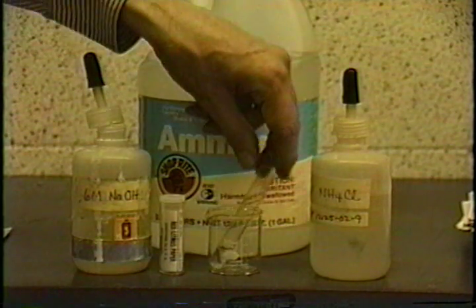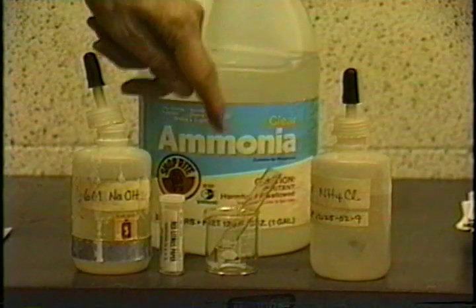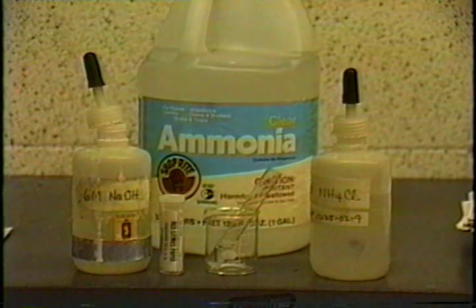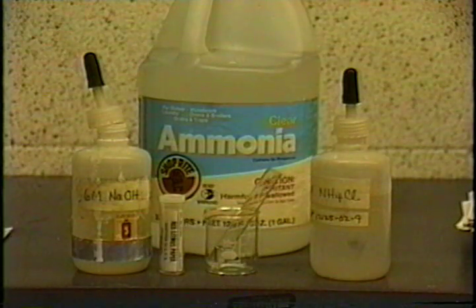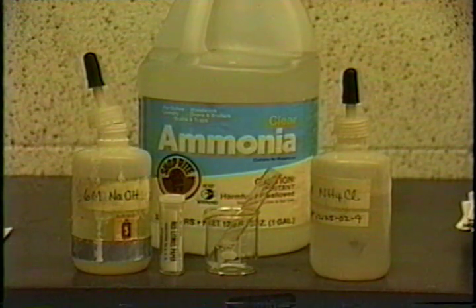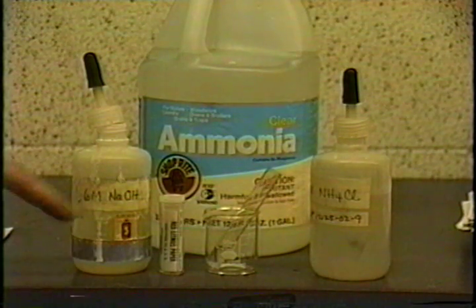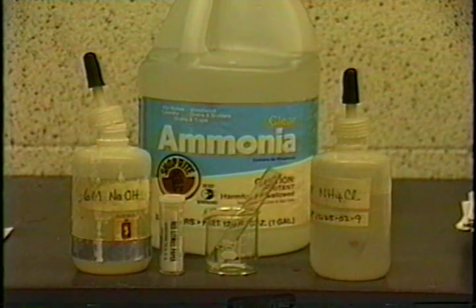Notice I'm using a 4-inch test tube, one of the small ones, because if you're generating gas, the 4-inch test tube will fill faster. All right, now we're ready for the test, and we could use either just smelling for ammonia, or more sensitive, we would use the litmus test. If we don't get a positive test with this, what we will do is we'll heat it and then try these tests again.